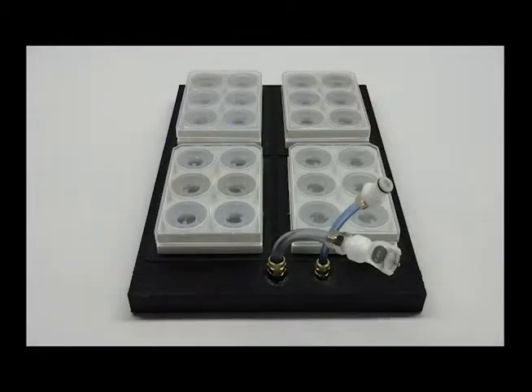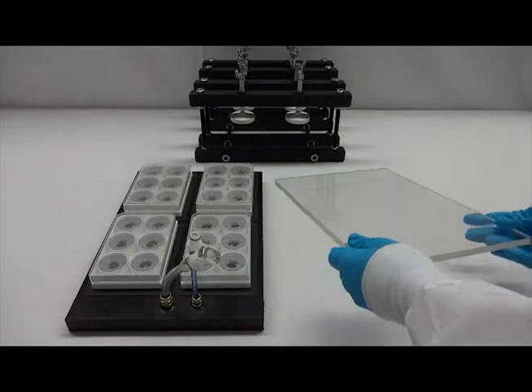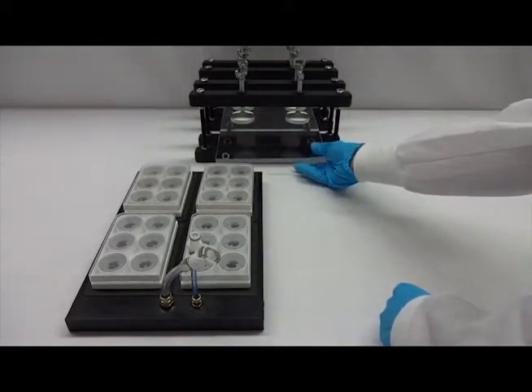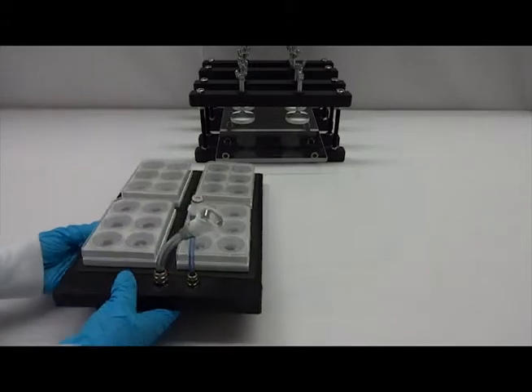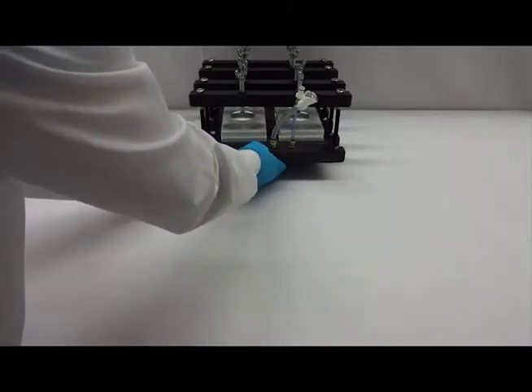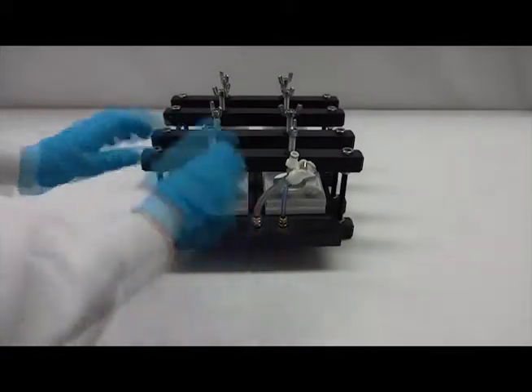After assembling your Biopress plate, center each on top of the four black gaskets in the compression base plate. Next, insert the acrylic window into the clamping system evenly along the bottom four clamping bars. Then, carefully slide the compression base plate with Biopress plates into the clamping system so that the plates are centered underneath the white clamping pads.